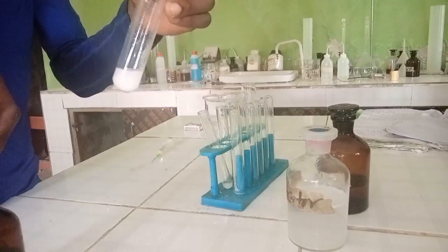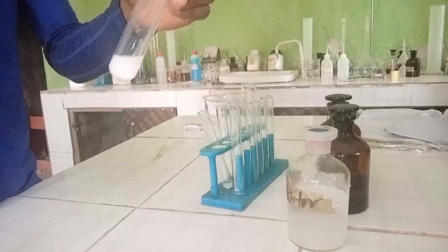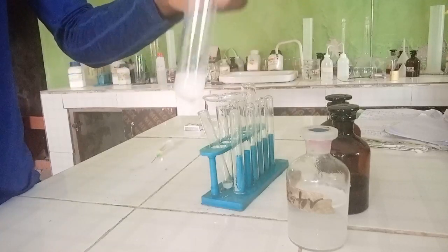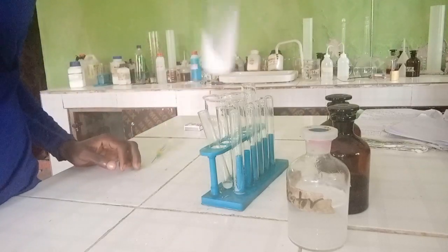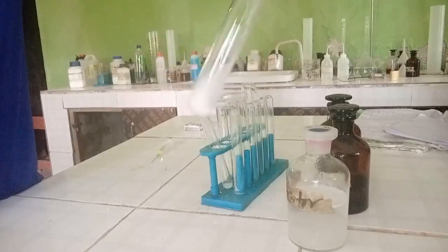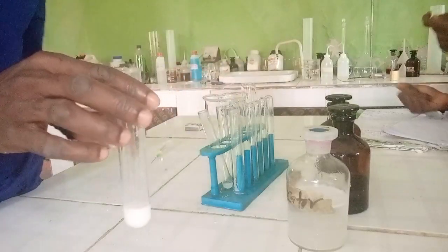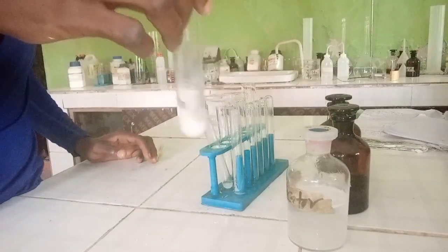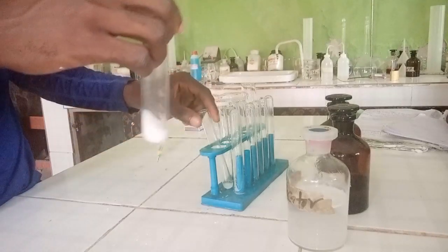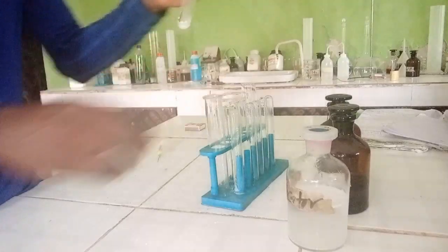For the addition of barium chloride, white precipitates are formed, so the anion that might be present could be CO₃²⁻, SO₄²⁻, or SO₃²⁻. But on addition of HCl, the precipitates dissolve completely, which shows the presence of CO₃²⁻ is confirmed.